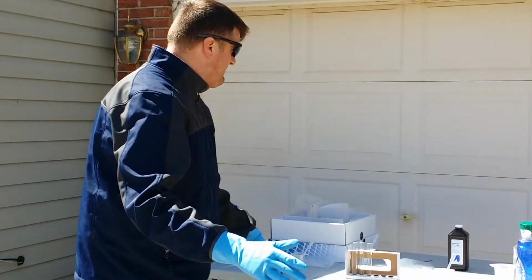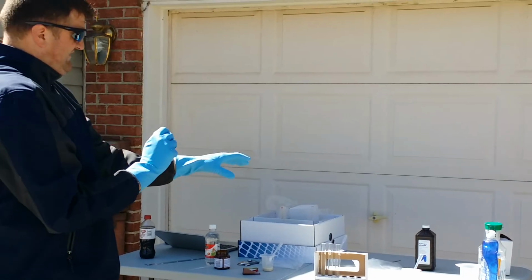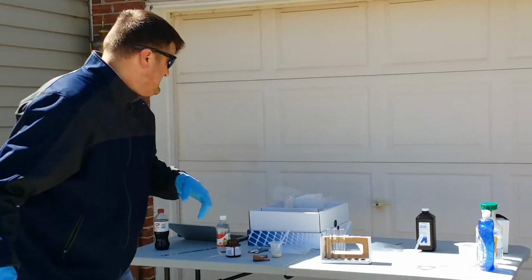None whatsoever. But I got to do this for this biology thing. So anytime you're mixing chemicals and stuff, I guess you need protection. My kit came with some glasses, but it's sunny outside, so I got these.